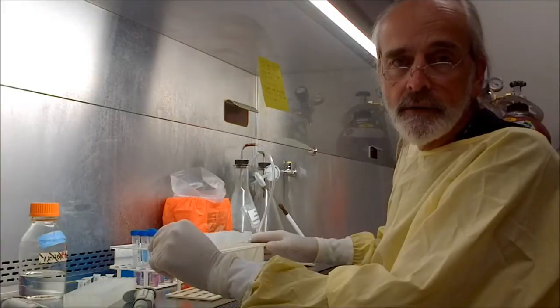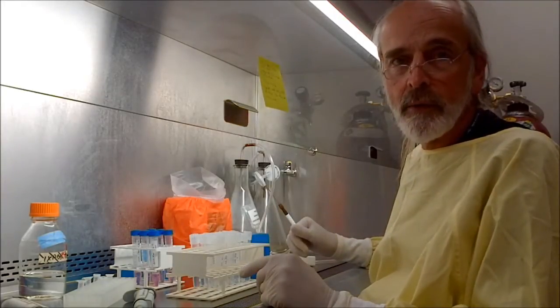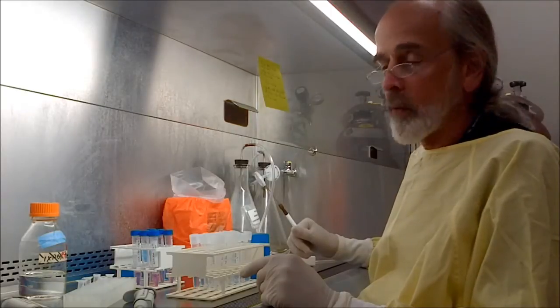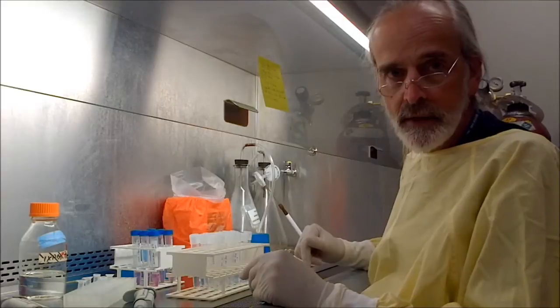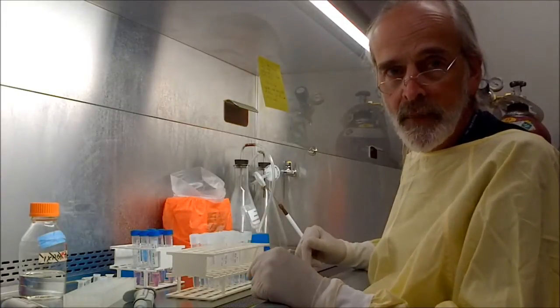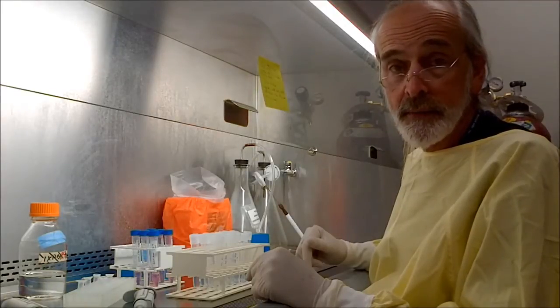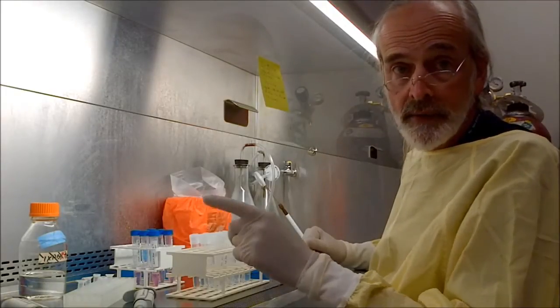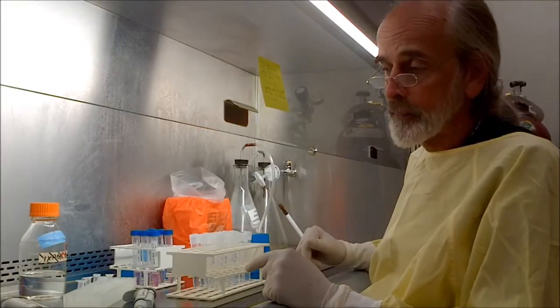I thought what I would do today is give you a better feel for what I actually do here in the hood when I'm working with the viruses. What I did before today was I took some GCT cells, actually 6 different plates of them, and I infected them with a virus, actually 4 different viruses that one of my mates here in the lab had worked with over the past few years.